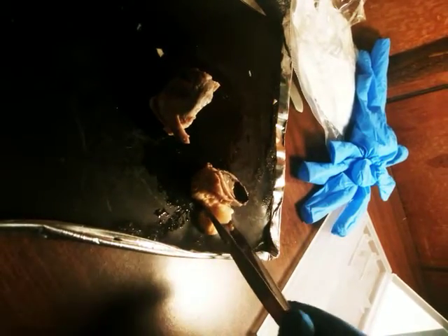Anyway, this is the anterior portion. This is the posterior portion. Or I'm sorry, posterior, anterior. And the posterior portion back here, you've got the optic nerve coming back behind the eyeball. It's behind the fat that I wasn't able to trim off.